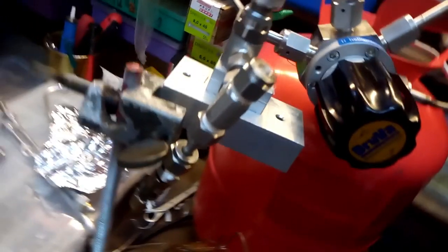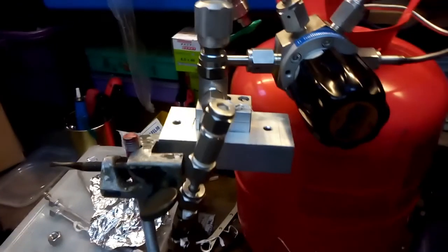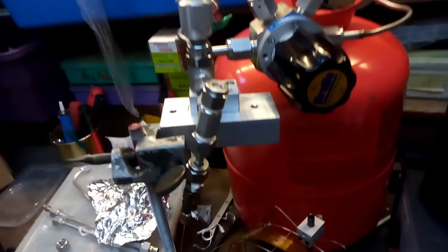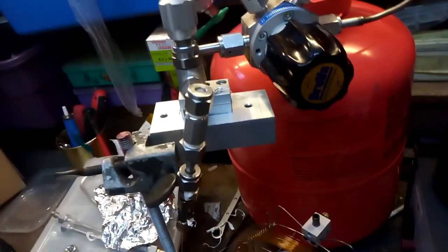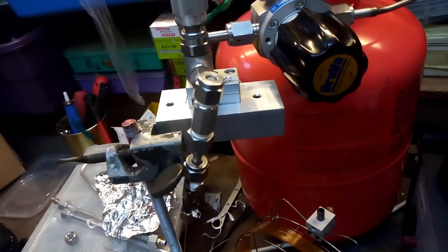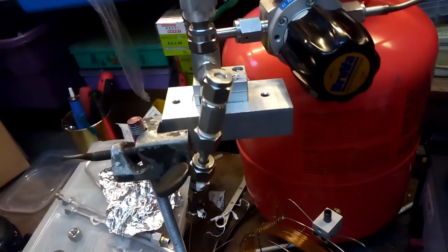not heated, and consists of a T-pipe with a septum. There's no split, so only headspace analysis is possible, otherwise the column would be overloaded. For the sample application, I used a 1 milliliter syringe.